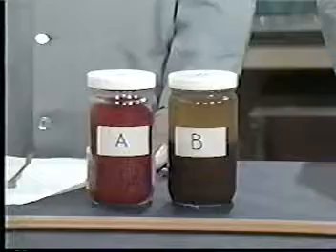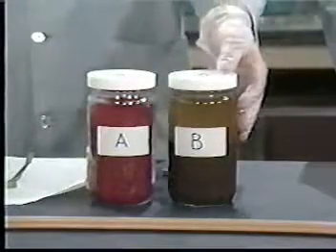For our demonstration, we are using waste B. If the waste will obviously yield no liquid when subjected to pressure filtration, that is 100% solids, this step and the one following it are unnecessary and may be skipped. That is why we put aside waste A.